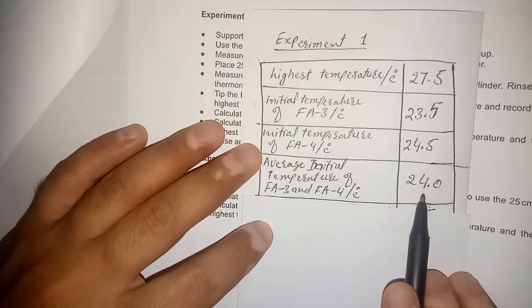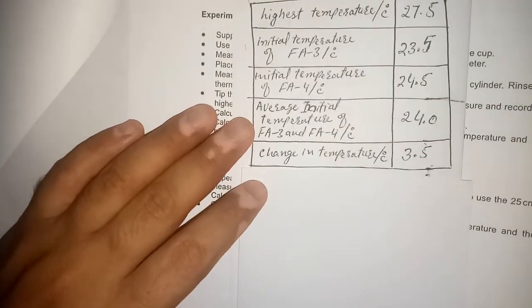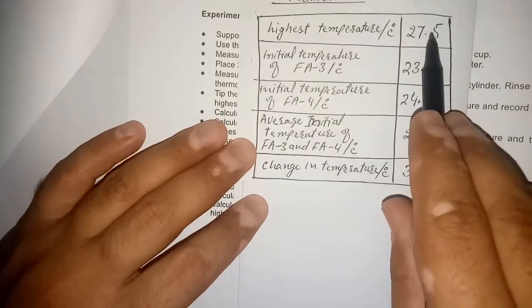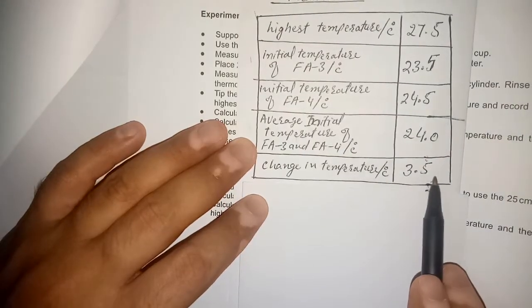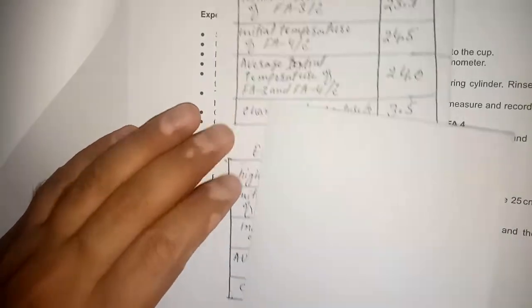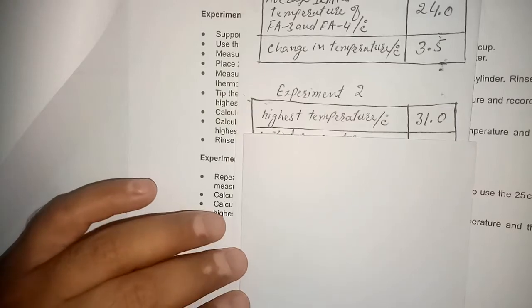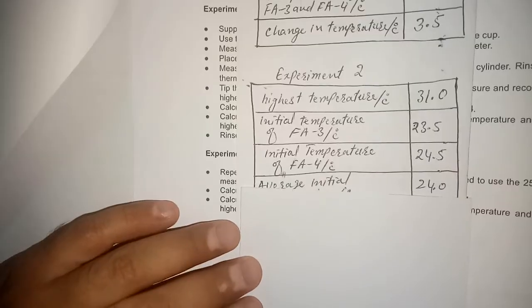Then we calculate the change in temperature: the highest temperature minus the average initial temperature. Subtracting these values gives 3.5°C, so this is the total change in temperature. Then we performed Experiment 2 using the same style to record the temperatures.